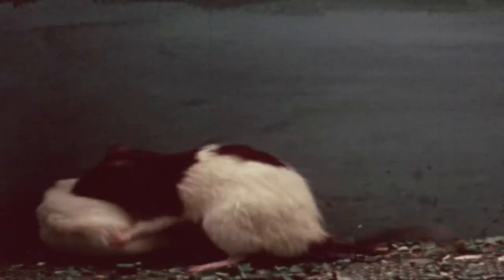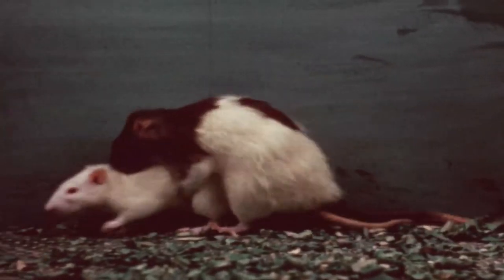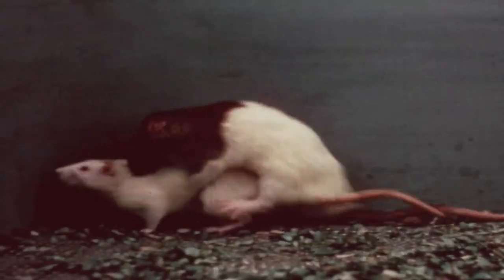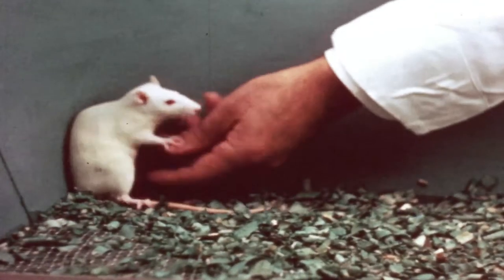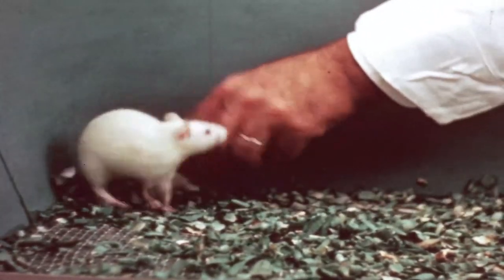The actual onset of mating may be determined easily and accurately by placing a female with a male. As seen here, a female rat which is not in heat will resist all mating attempts of the male. She will likewise be resistant to manual stroking of the pudendal area and will invariably attempt to escape.